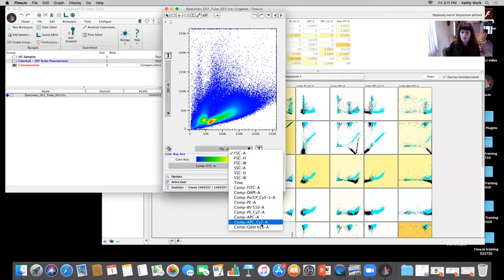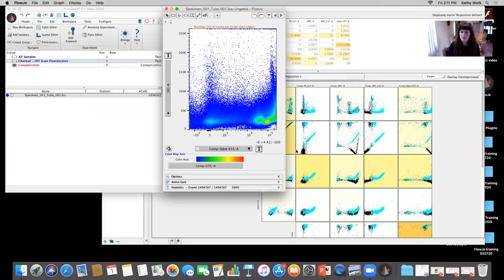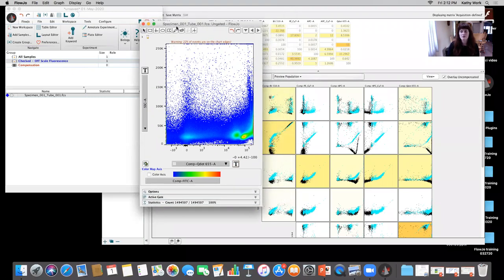When I come here and I look at this detector, what I see is 22% that's off scale. Okay, that is no good. And what we talked about from our previous discussion about compensation was the need to make sure that not only are we running our single colors, but that our single colors are appropriate for what we're looking to do. Because if you have off-scale data, the compensation isn't going to be correct. This is a very brief example.